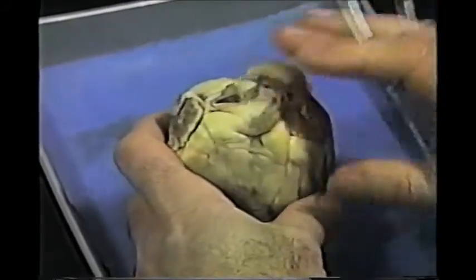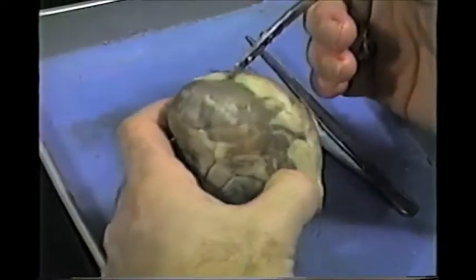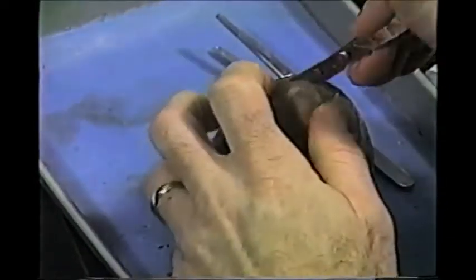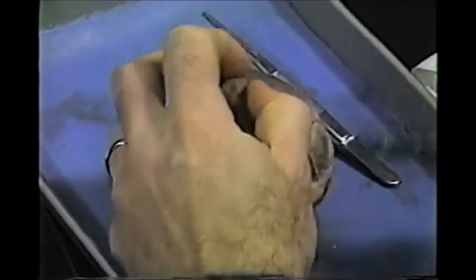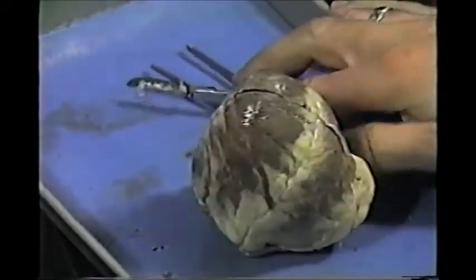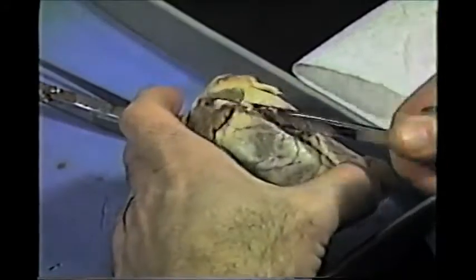Once you've found all of these landmarks, we're going to dissect the heart. We're going to put it on its base, take a scalpel, and cut through both ventricles — the right ventricle and the left ventricle. It's going to be hard going because this ventricle is very thick; it's made of thick cardiac muscle, especially the left side. The left ventricle has the thickest cardiac muscle of all four chambers. You might want to start with the scalpel and cut down, then take scissors and finish the job. You don't want to cut it completely through — you want to leave a hinge at the base.